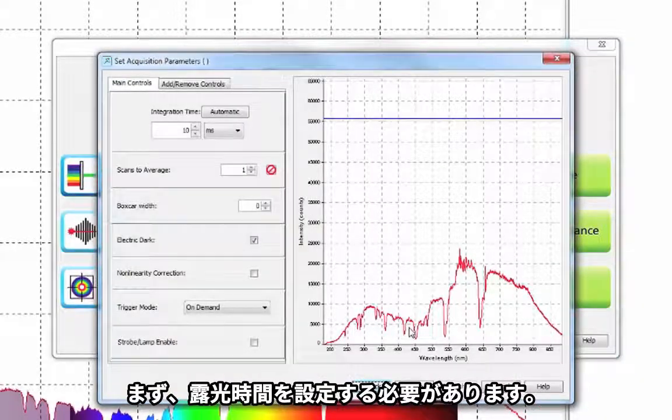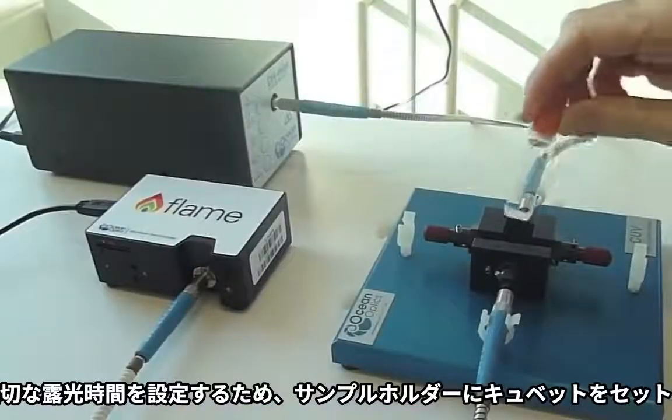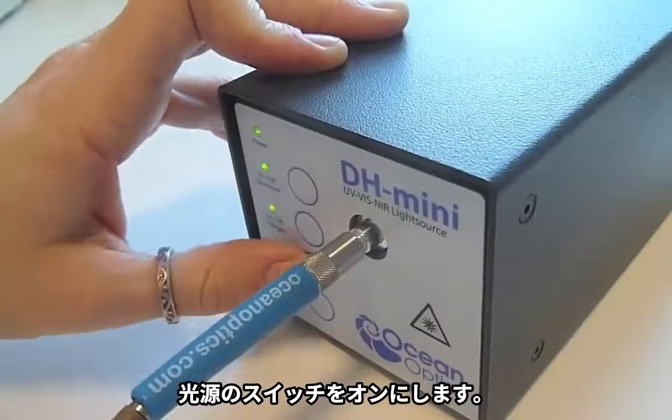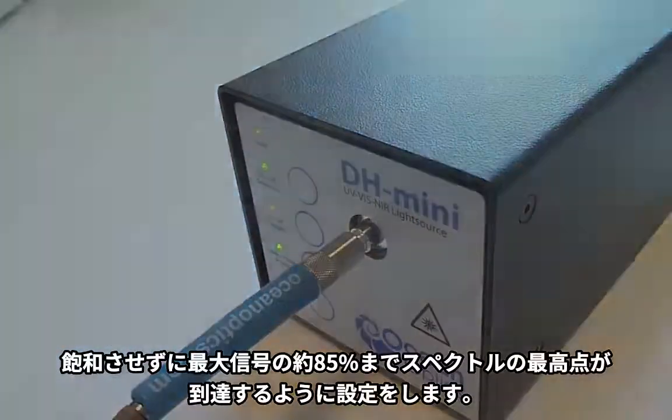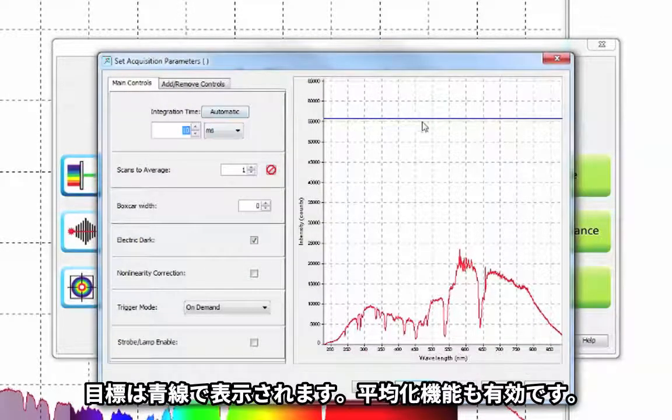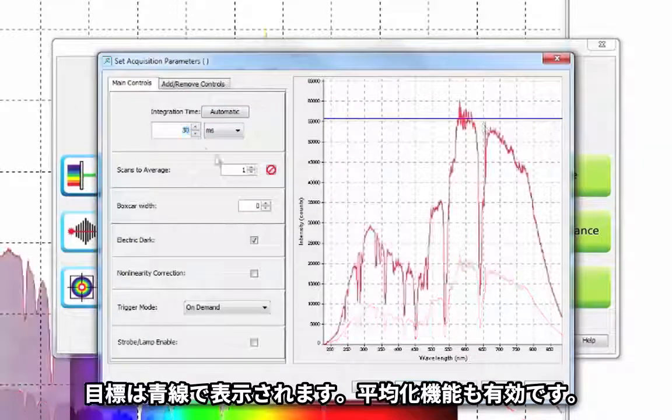You will need to choose your integration time. To pick a suitable integration time, put your sample in the cuvette holder and switch on your light source. You will want the highest point on your spectrum to reach up to about 85% of the maximum signal that your spectrometer can receive without saturating. This is indicated by the blue line shown here.